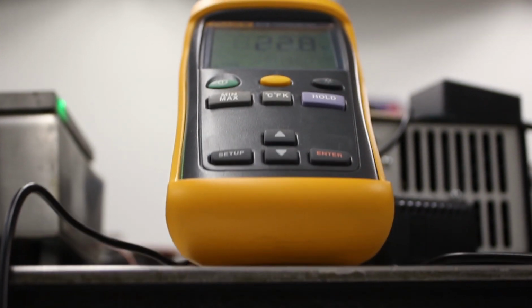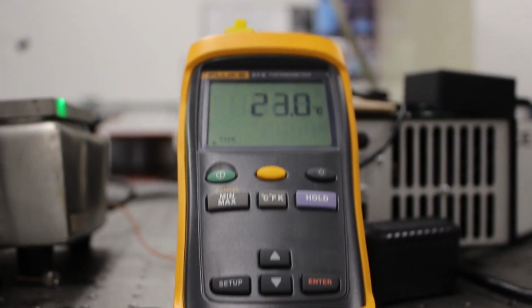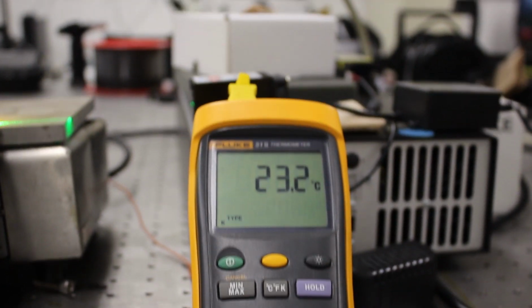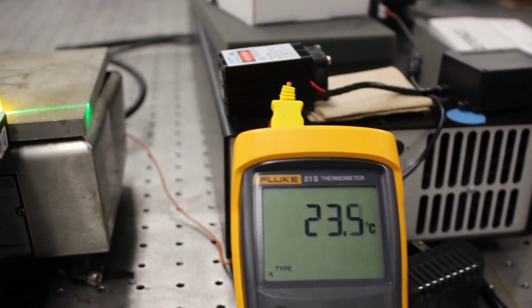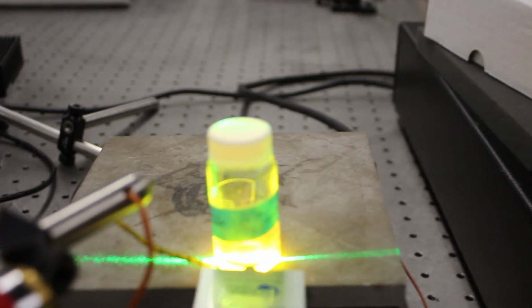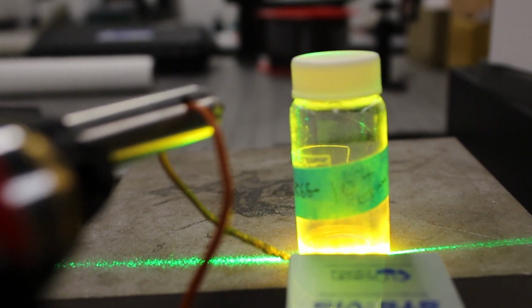The thermocouple is used to measure the temperature of the specimen at any given time to later be used in calibrating the data of the intensity of the light spectrum versus the specimen temperature. The thermocouple is used to calibrate the sensor based on the rhodamine 6G dye. A thermocouple gives a more accurate reading of the temperature than the hot plate readout, leading to more exact data.